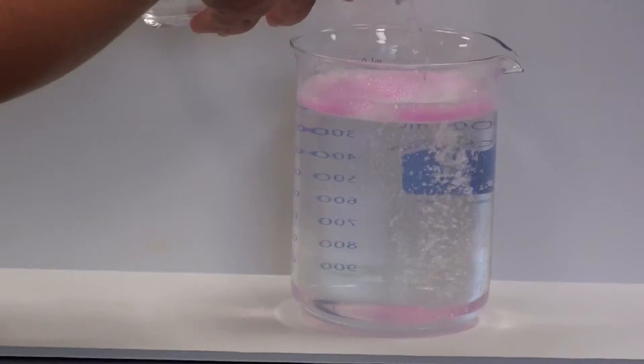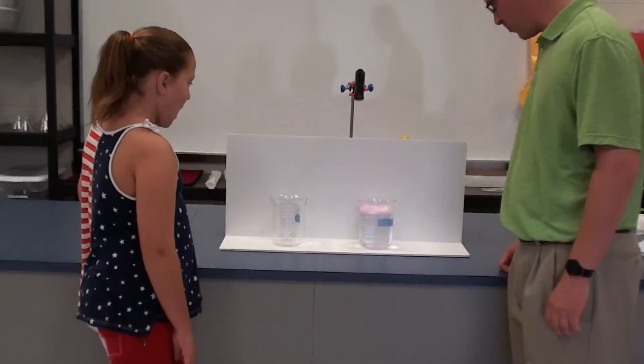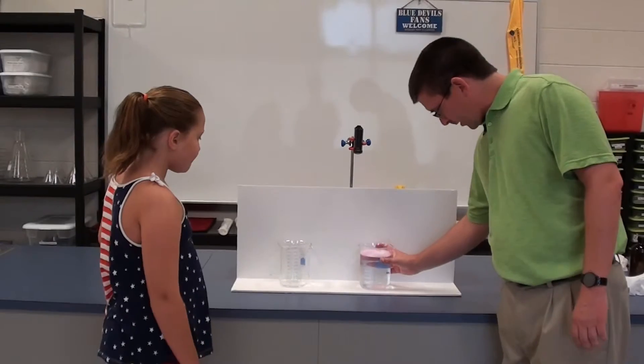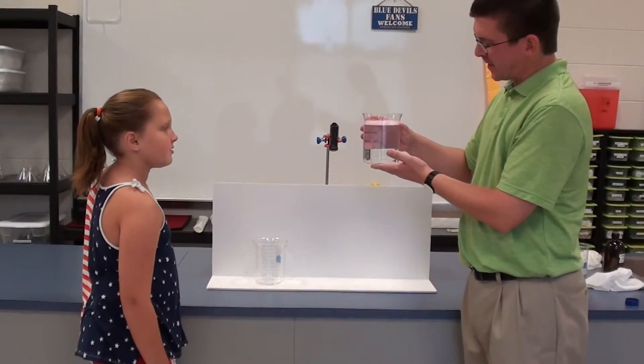Okay. So what happened now? It turned clear. It turned clear again. We've got a little bit of the foam still on top, but the liquid has turned clear.